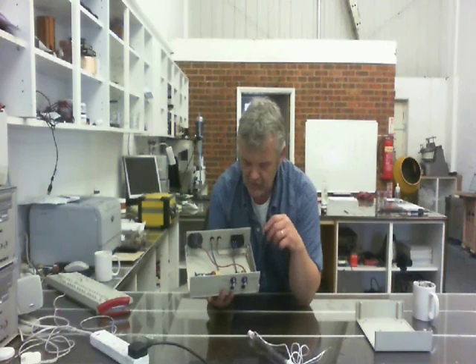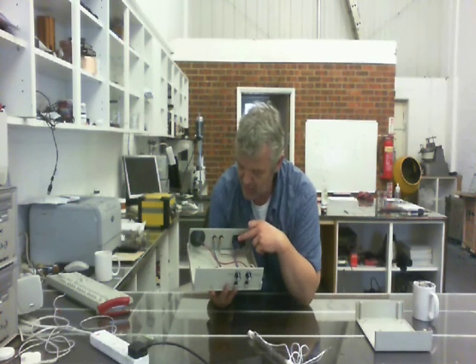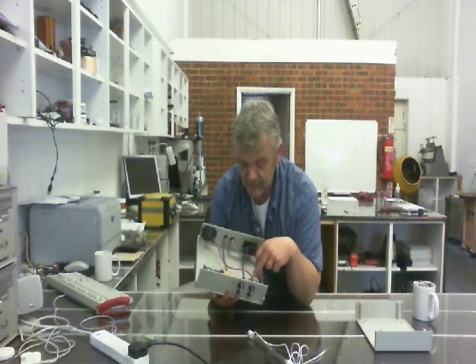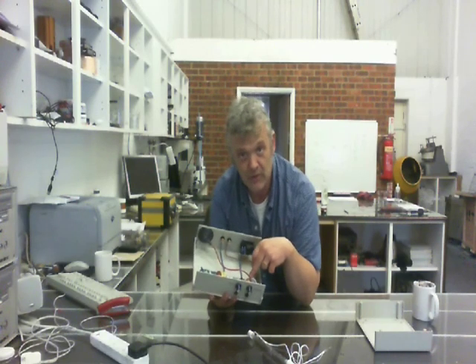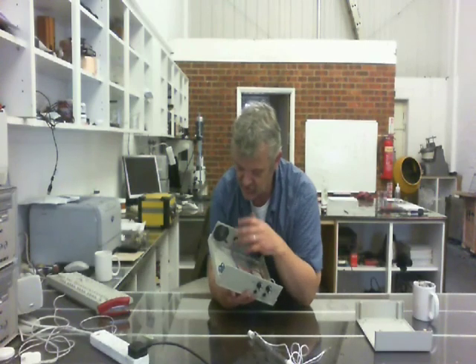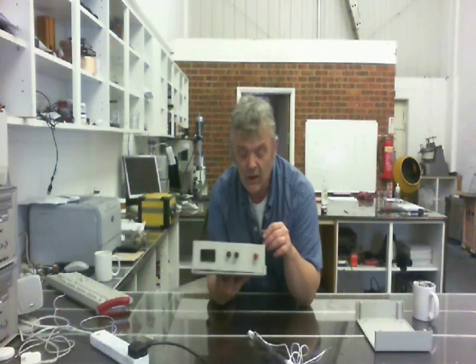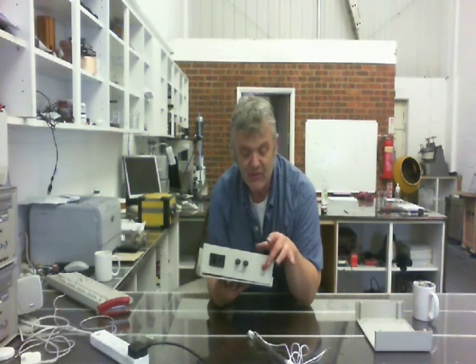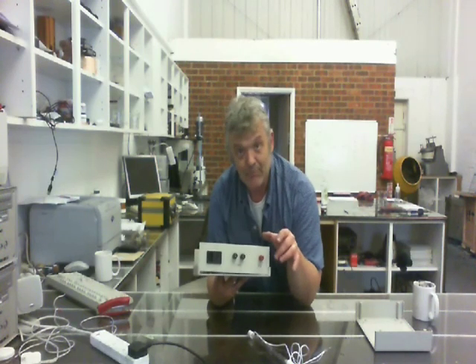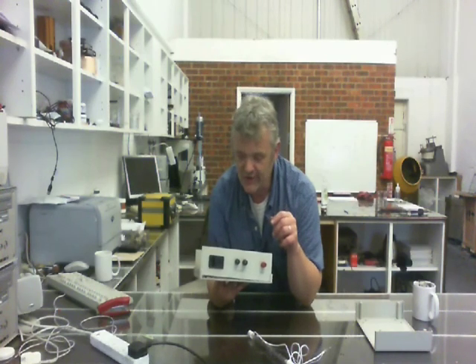Now, what you can see I've done inside is pretty simple. I've wired it up according to the circuit diagram, going to the mains and then two banana plugs. And this is the high voltage going here. And I've actually nicked a bit of high voltage wire from an old television circuit I had kicking around. So we've got a nice isolation. It's got a good distance and a bit of insulation over there, stopping the high voltage. And then out the back of it, I'm going to lead that to the lamp and that to the high voltage trigger of the lamp. And clearly, I'm going to build the lamp as a separate unit, so we've got two more things to do: to build the lamp and to make the cables to do the connection.